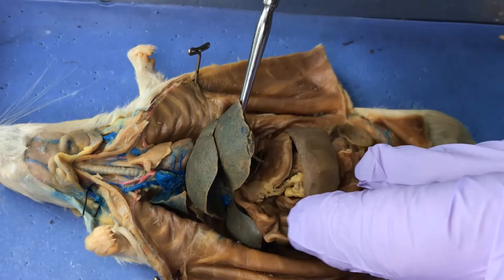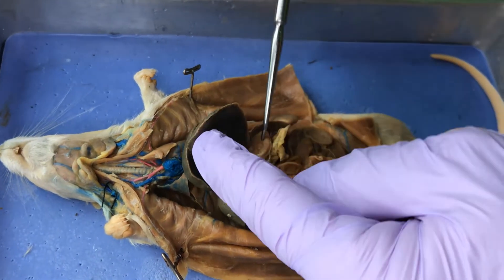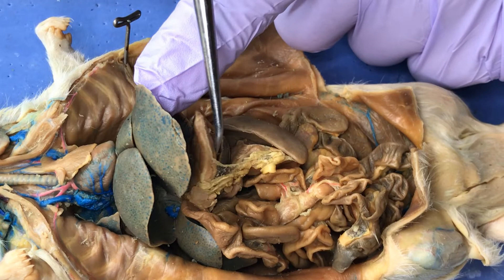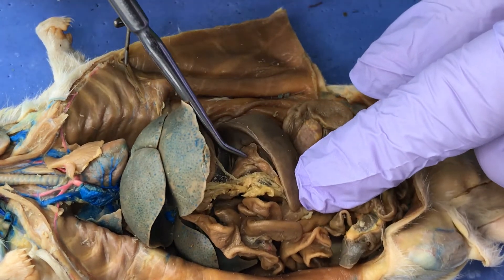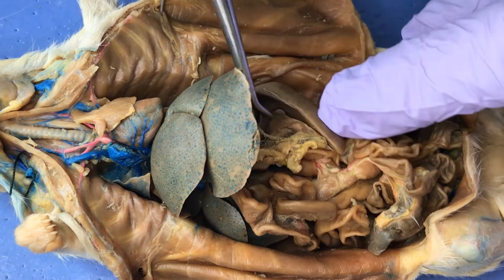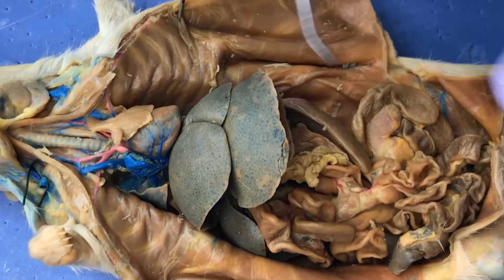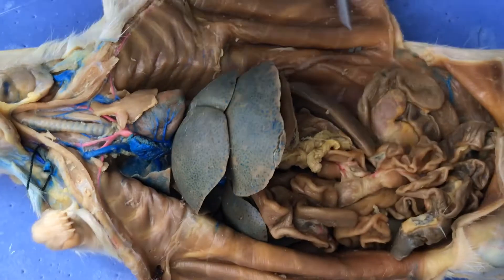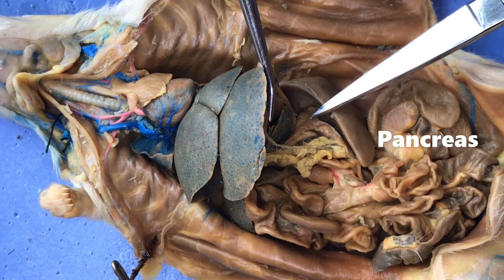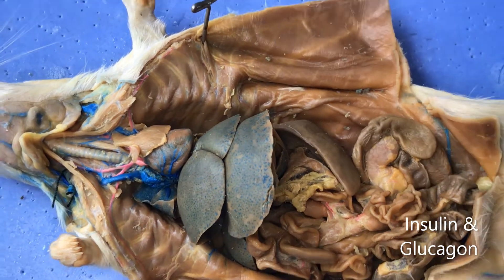If I flip up the liver and the spleen, I'm going to see a mass of tissue. Here's a landmark — the stomach right there. Now, liver, stomach, and if I flip up this, you can see this kind of chewing-gum-looking stuff in there. Between the stomach and the spleen, in this membrane called the mesentery, is what they call a diffuse organ — it's kind of spread out. Right there, using the scissors to point — that's the pancreas. The pancreas functions in digestion but also in your endocrine system in the production of insulin and glucagon.